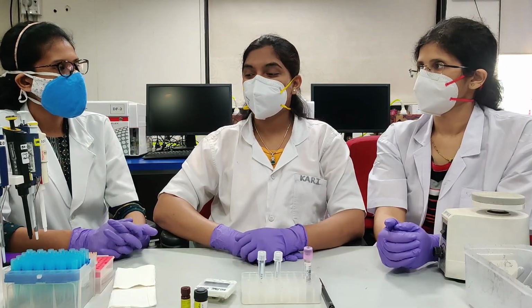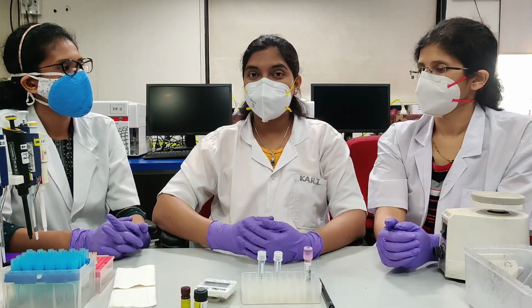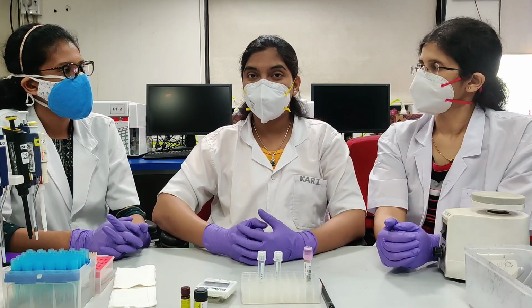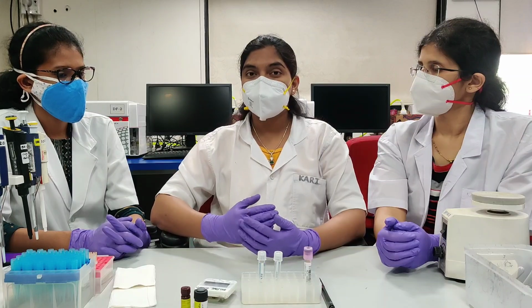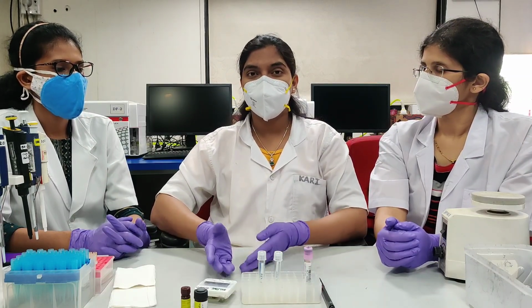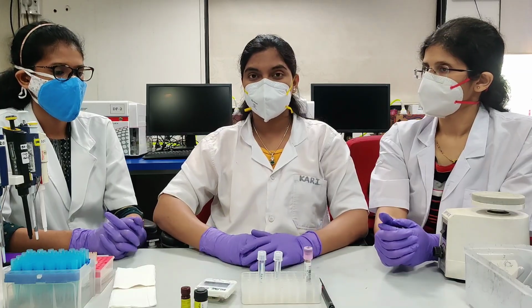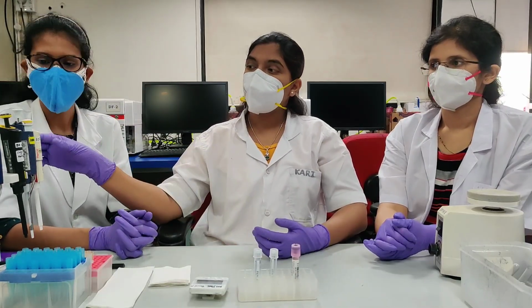What is reverse pipetting and why do we do reverse pipetting? Reverse pipetting is a technique to dispense a measured volume in a precise manner, which reduces splashing, foam and bubble formation that will affect your absolute counts. I will now demonstrate reverse pipetting to you.